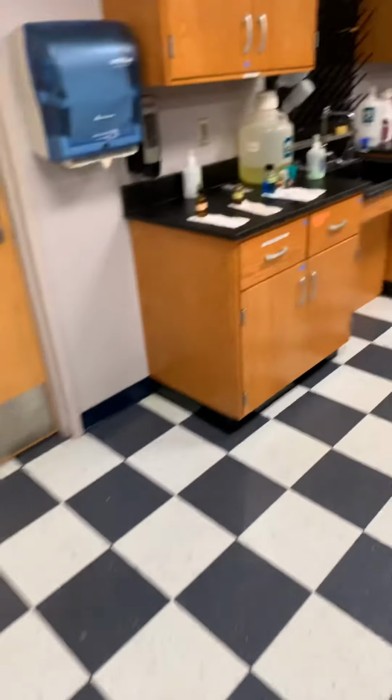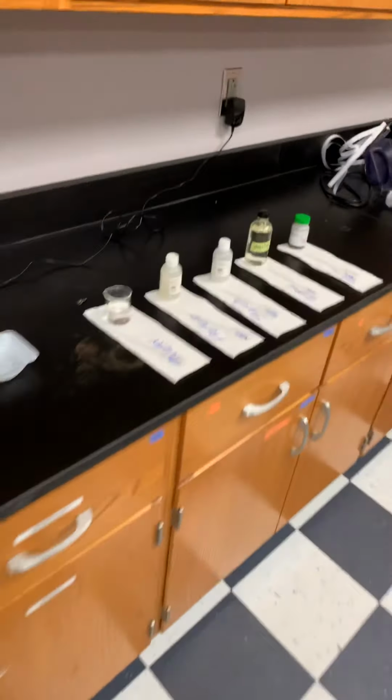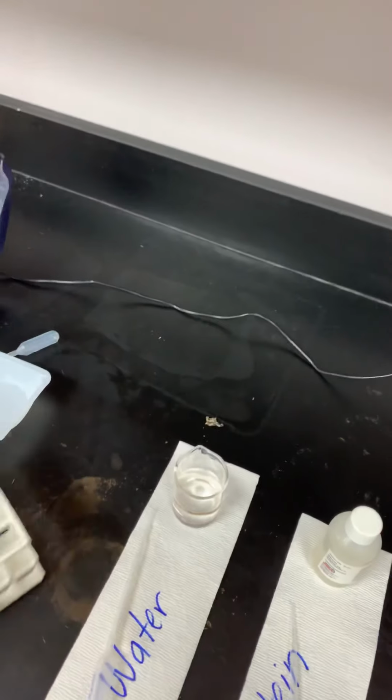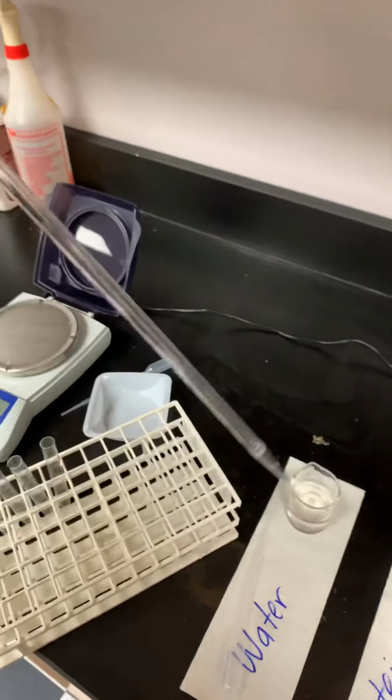Into tube number 1, you're going to put 8 milliliters of water. And then into tubes 2, 3, and 4, you're also going to put water, but in this case, it's going to be 4 milliliters of water. So let's go over here. Again, the water is going to be on the side, just like it was in the qualitative analysis. You can use that same beaker of water, but instead of the transfer pipette, you're going to use the graduated pipette.